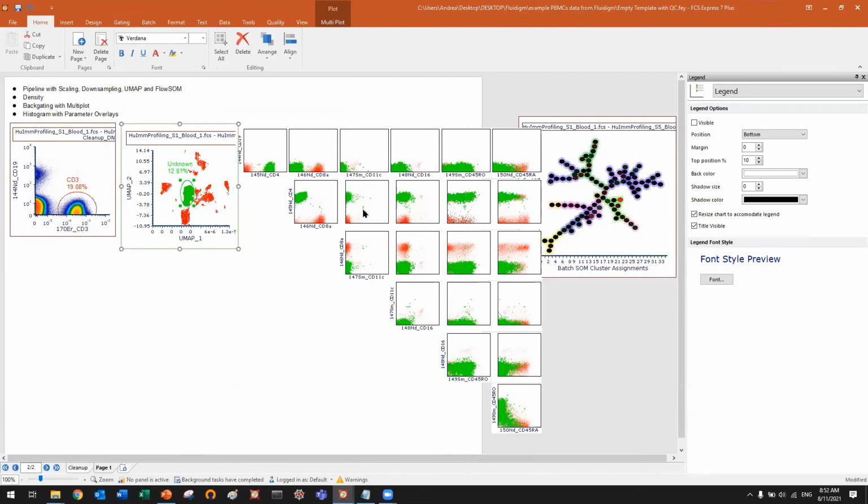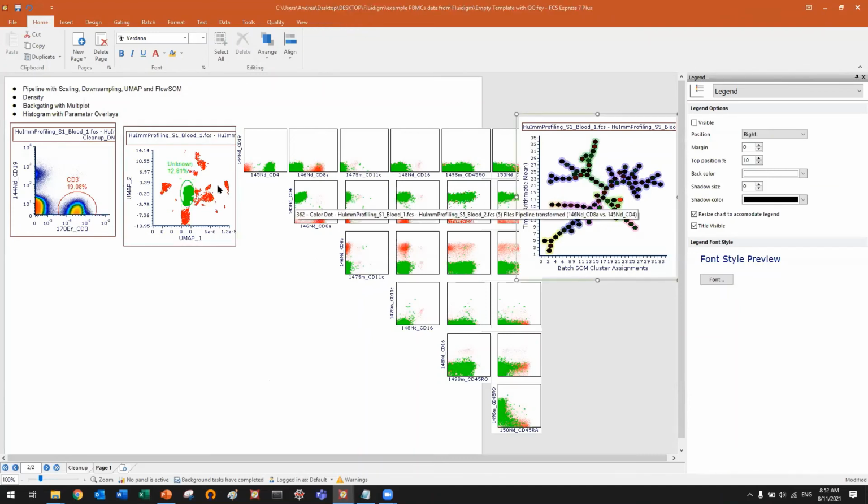Now, let me just conclude saying that we have much, much more stuff. We are running out of time, so we cannot see everything, but we have many other options. We have heatmaps, for example, that are really useful. We have graphing tools. We have high resolution pictures. We have many, many other algorithms. So FlowSOM and UMAP are just a few of them, okay?